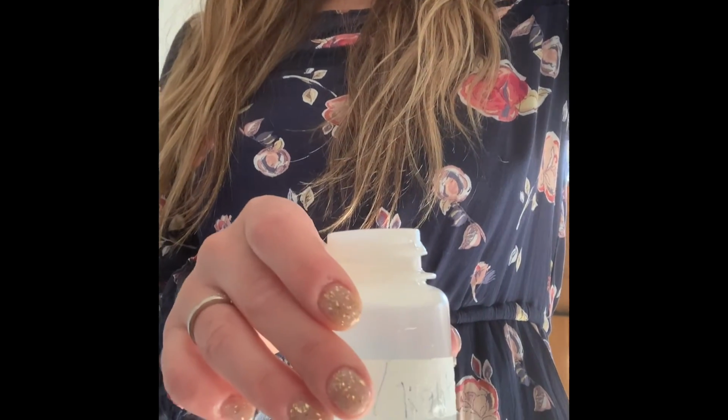I'm gonna go ahead and place this bottle into the dark cabinet, and then tomorrow I will take samples doing what I just did. I will take readings for the dissolved oxygen levels for both the light and the dark sample.